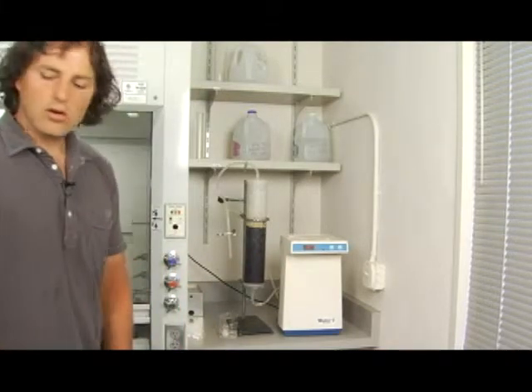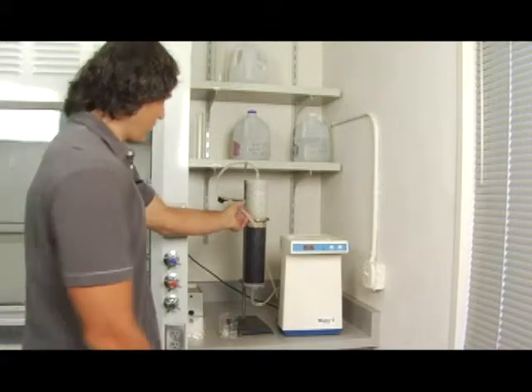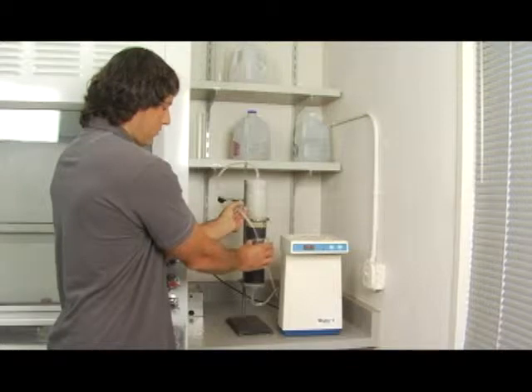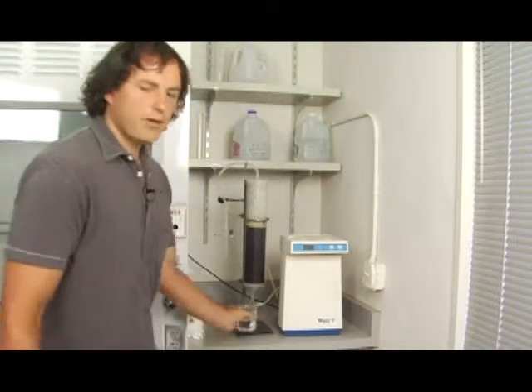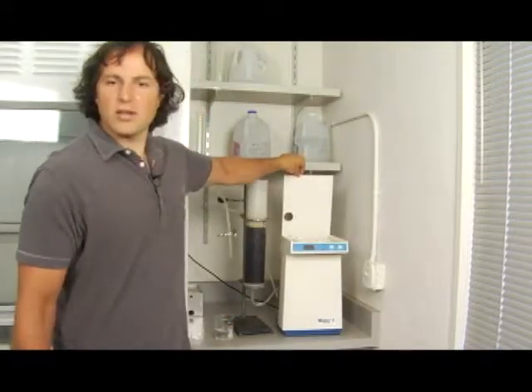When you want to get water, simply grab this valve here, have your beaker and squeeze. Then turn it off when you're finished using it. Make sure that the reservoir level is near the top.